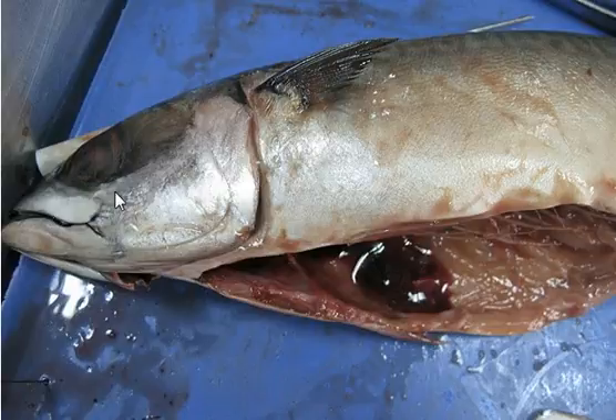First, this is the eye and this is the mouth. In the mouth there is a tongue and teeth — the teeth are really small and really sharp, and the tongue is really sharp too. Now this thing over here we had to cut out — it's very hard to cut and it's called the operculum, which protects the gills.